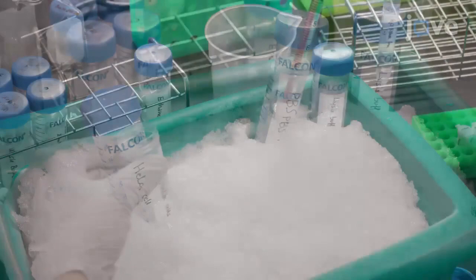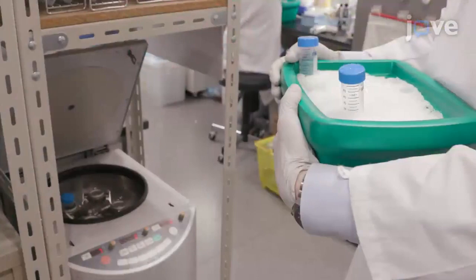Begin this procedure with preparation of HeLa cells as described in the text protocol. Wash the cells once with 10 milliliters of PBS.